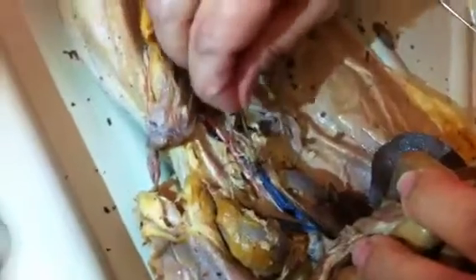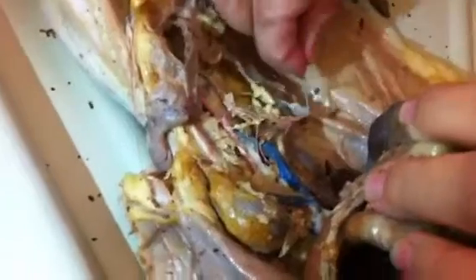That one's still attached. You can see the blood vessel going to it. So that would be the gonadal. Where's that one? And that is this guy there. See, it's really, really fine. It comes off right after the renal. But when we had that one pregnant one, that got really big. That got really large. We had that one that had all her babies in the uterus.